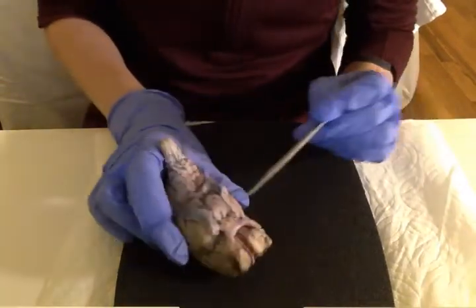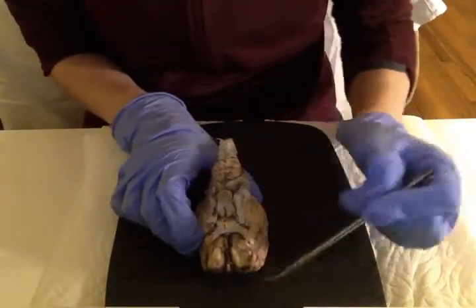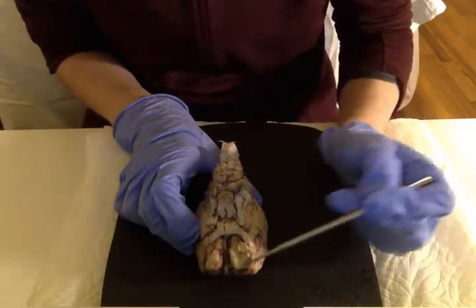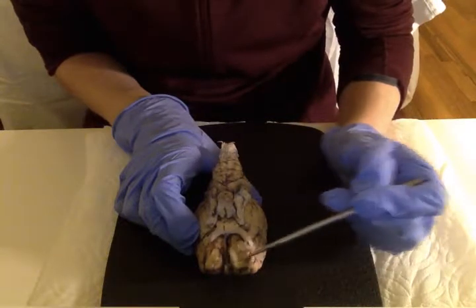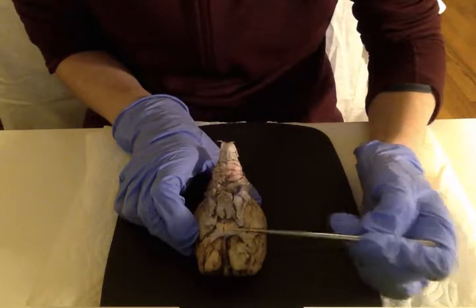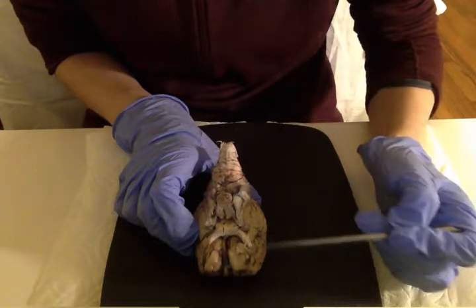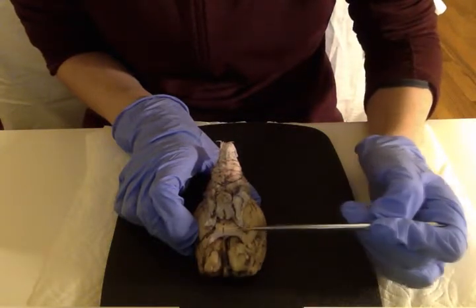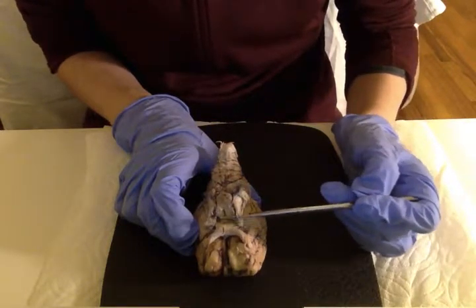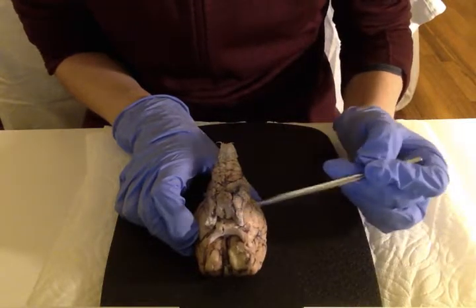All right, now I'm going to flip this over, and I'm going to start up here towards the frontal region. First off, starting with the olfactory bulbs, these are actually pretty big, and there's two of them right there. Behind that, we have two optic nerves. The optic nerves run up to the eyeball region, which obviously isn't on this dissection. When the optic nerves run back towards the back of the brain, they partially cross, and there's this little X-shape area, and that is called the optic chiasma.